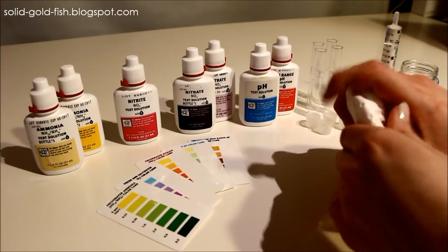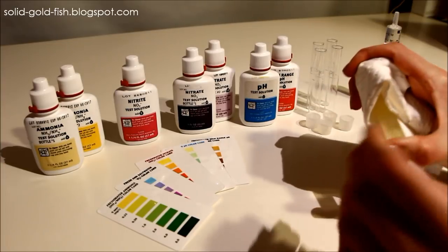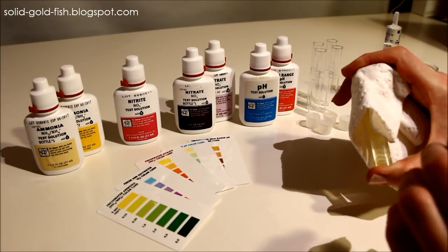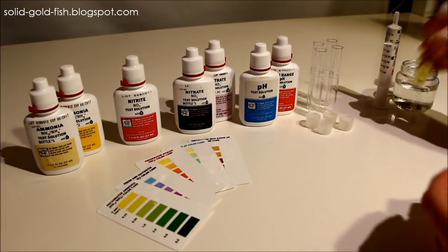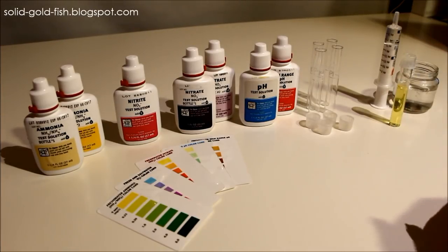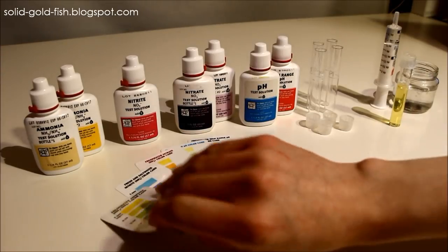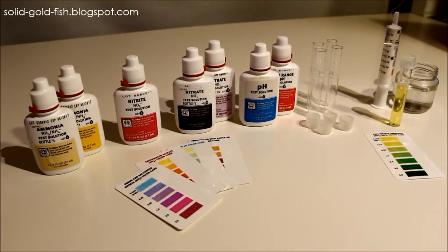Just press it down and shake it for five seconds. Once you're done with that you can just set that aside. It has to set out for five minutes before you can match it up with the color card to read it.